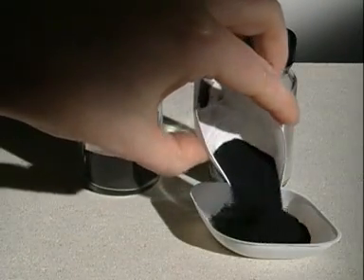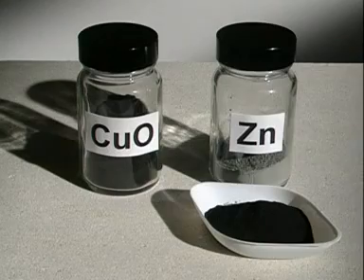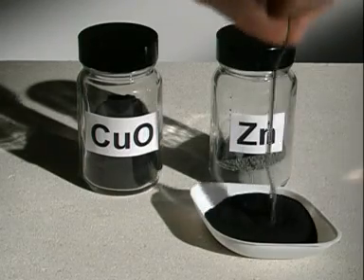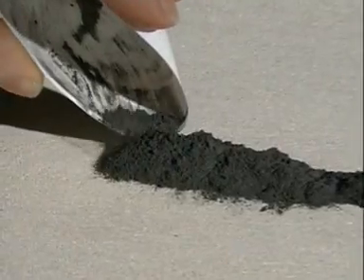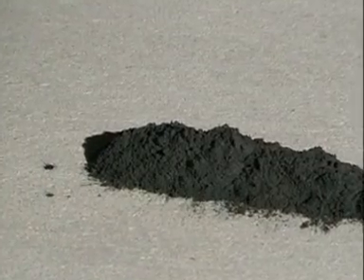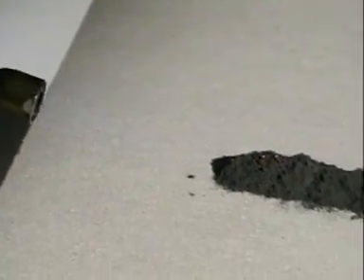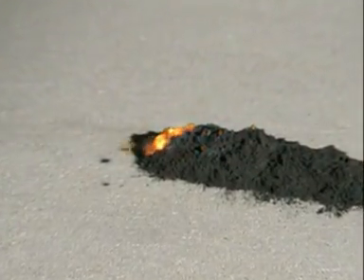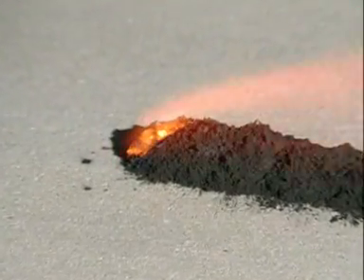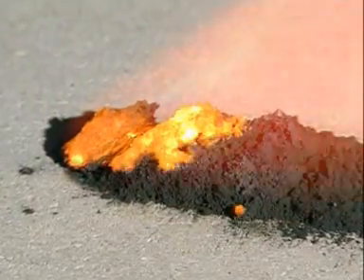Chemical reactions tell us about a metal's reactivity. Mix zinc with copper oxide, lay the mixture out on a heatproof mat and heat one end. A reaction soon begins and spreads through the mixture without further heating.